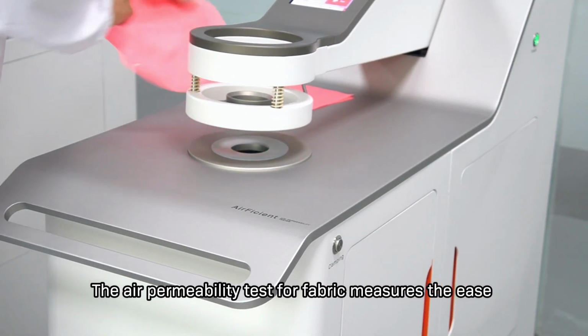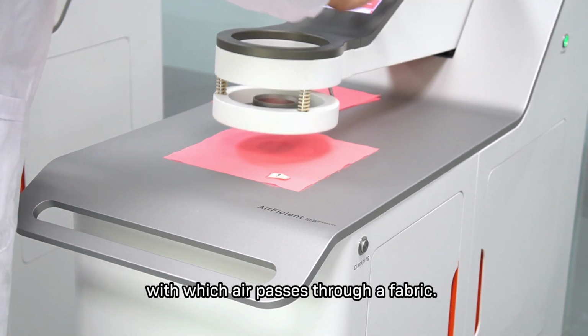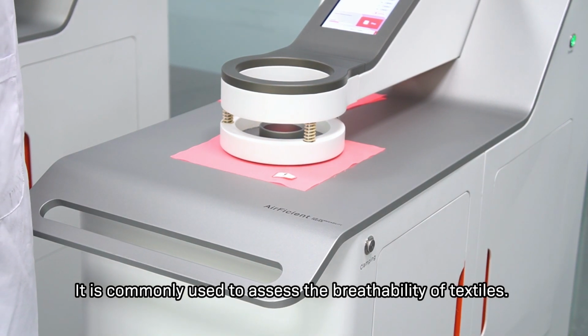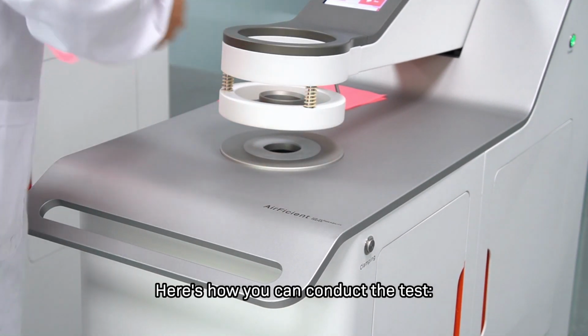Air permeability test for fabric measures the ease with which air passes through a fabric. It is commonly used to assess the breathability of textiles. Here's how you can conduct the test.